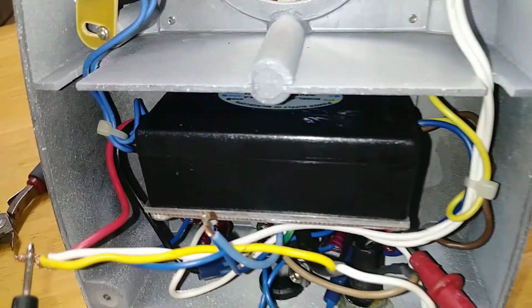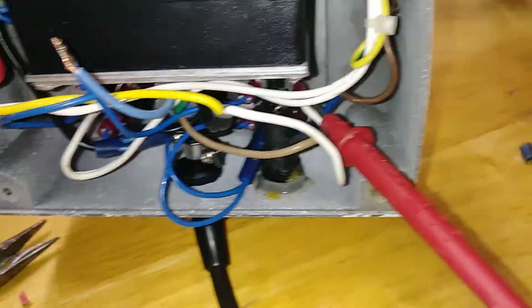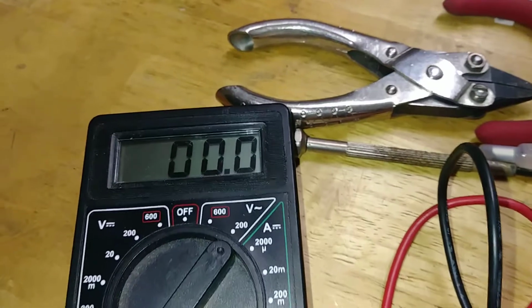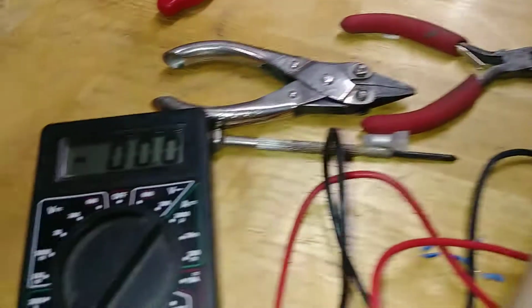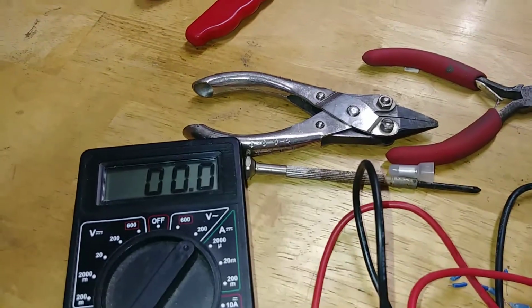So basically I'm going to touch this to the positive. See the red coming out of the box going into these? That's the white and the yellow. So the yellow goes in, that's the neutral. Now you're reading no voltage whatsoever, correct? Right? No voltage. Watch this magic.